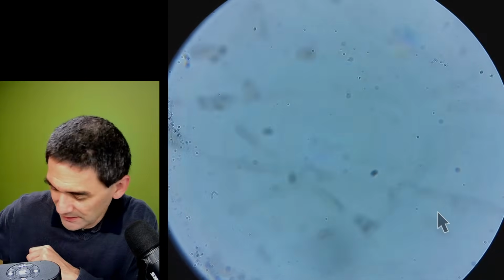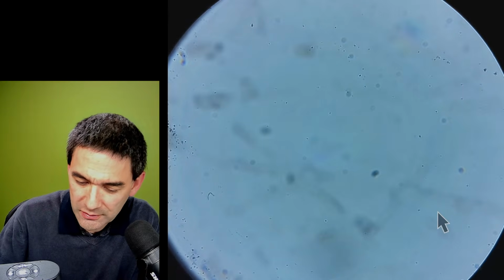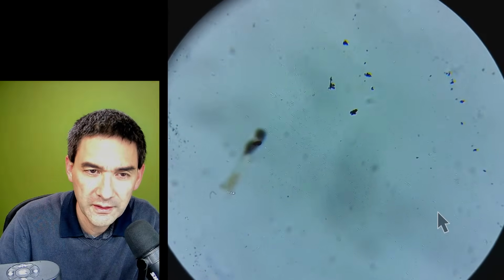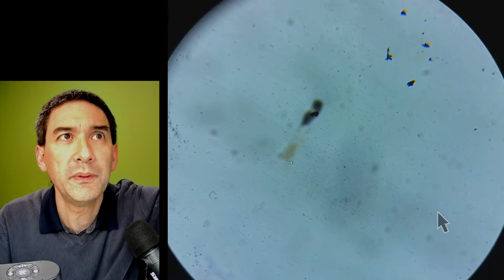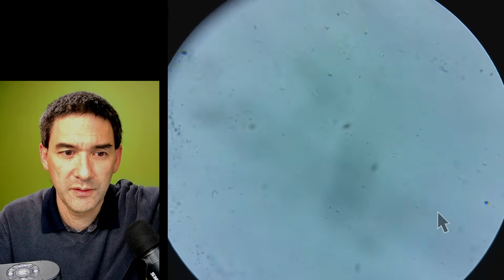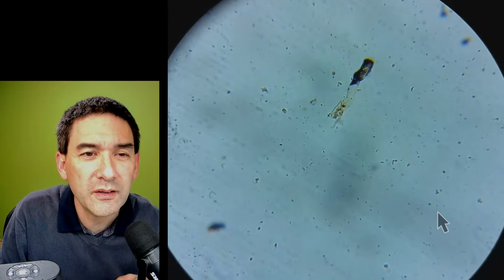Last one. Let's have a look at the last one, and then let's have a look at a few of the questions. Female mosquito mouth parts. Okay. Let's go down here. We have to find it again. That was weird. Why did my lamp go up in intensity? My desk lamp. Okay. See? I can't find it. Is this it? No, come on, not really.